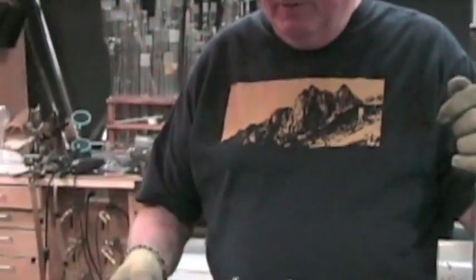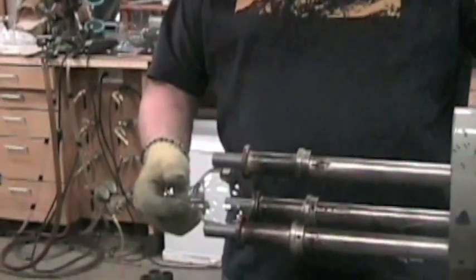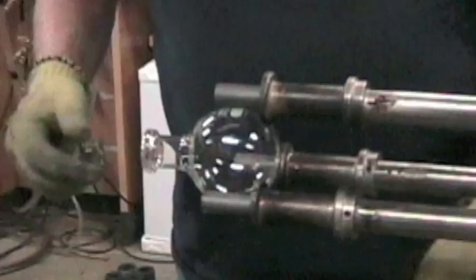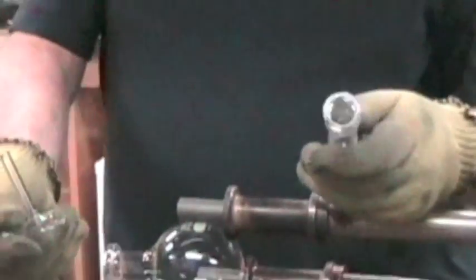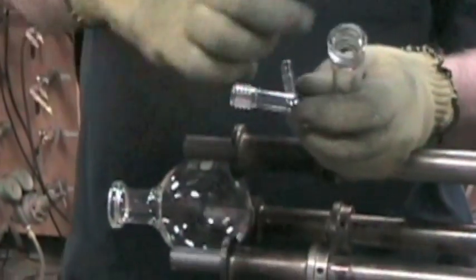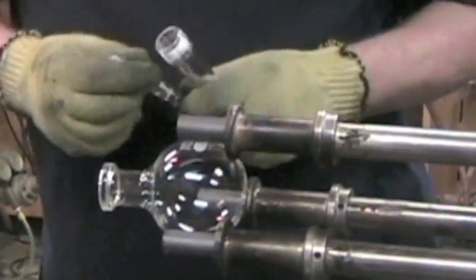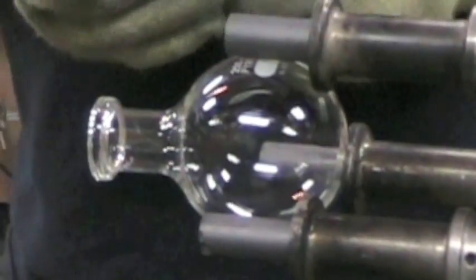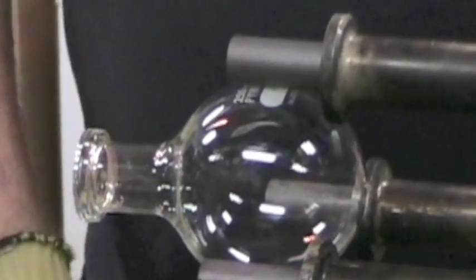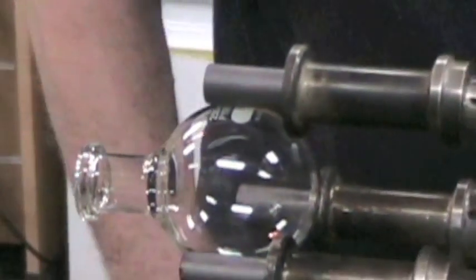Okay, we're about to assemble some flask here and put some side valves on it. Screw on joint. We're taking two pieces already prepared with screw on joints on the end of them so they can attach them to other equipment. This is the flask that's going to go on. And if I can find all the stoppers.